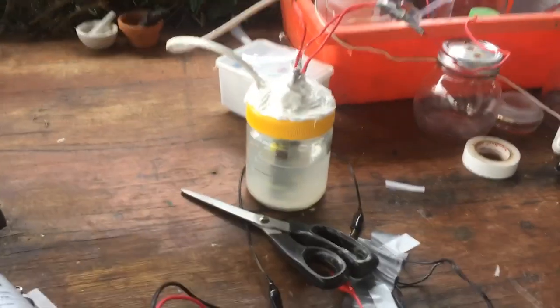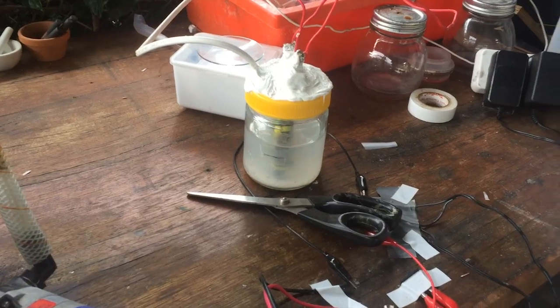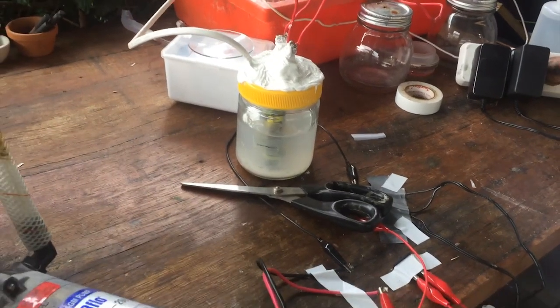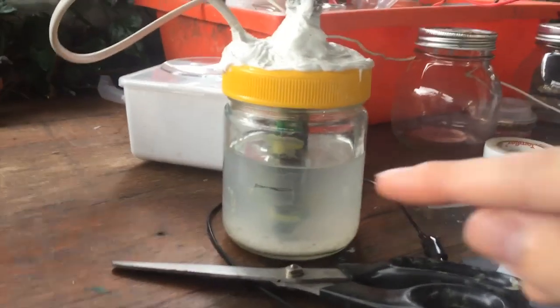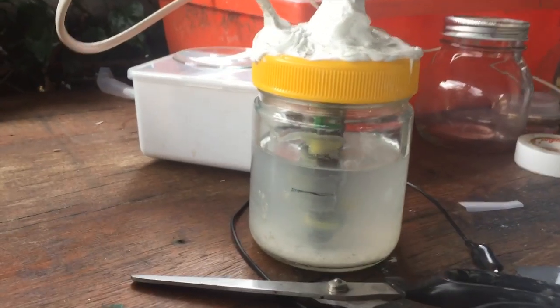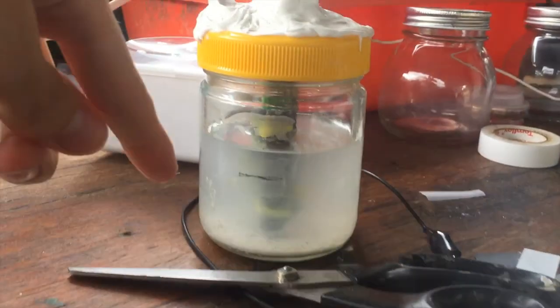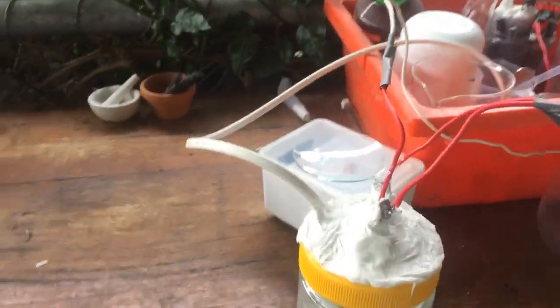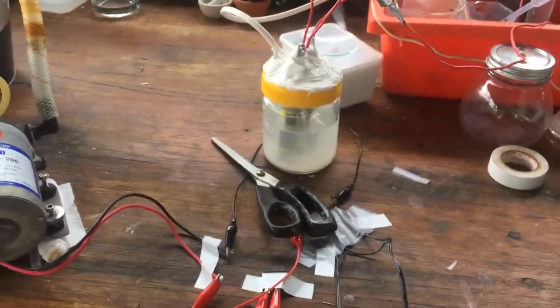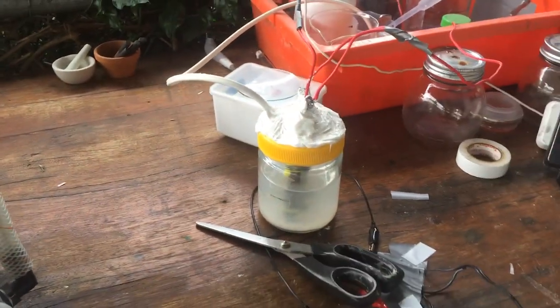The distillation is done and we've got all the water we need in there. I don't know what I told you about the concentration of the deuterium last time — I think I was probably wrong about that, but anyway, I've redone the maths, and by the time we reach that line we should reach the point — sorry, my hands are a little bit shaky — where the water in the jar is approximately 20 times the normal concentration of deuterium.